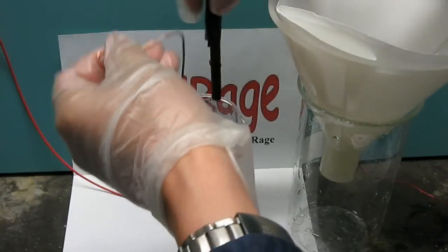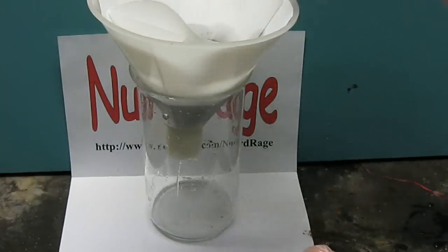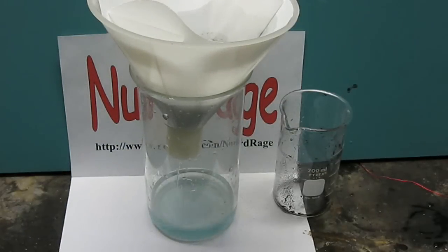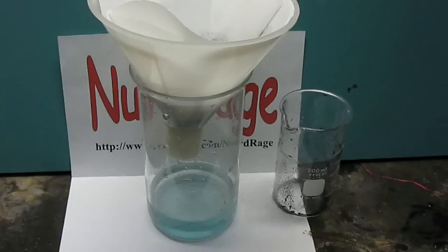Anyway, after about an hour, I stopped mine and the next step is to filter out the suspended particles. As you can see here, I stopped it short, so it's not fully converted. It will have to be put back through the cycle until it's clear.